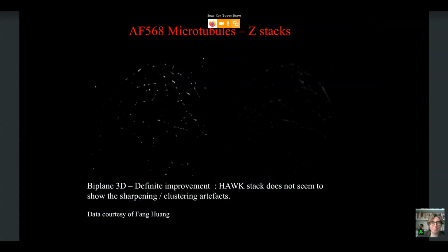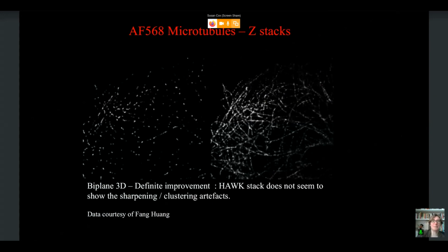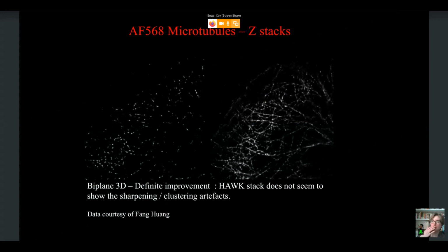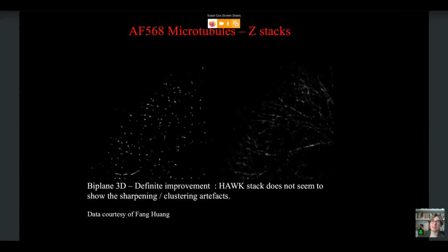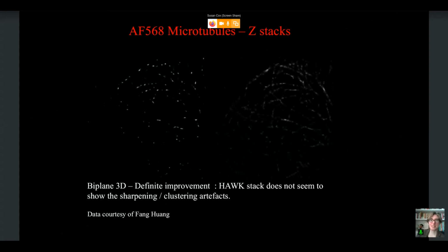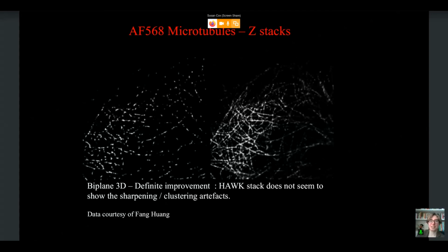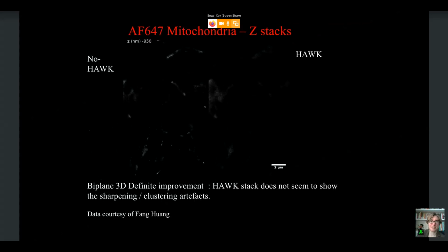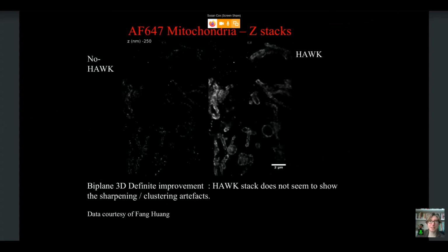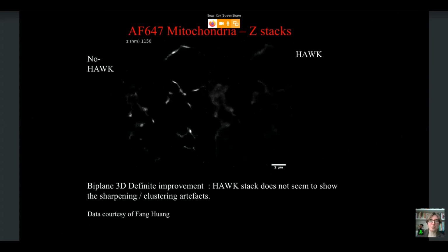Much better is the biplane approach, where we seem to actually get a really big improvement over the whole range and without any of the problematic aspects that you get with astigmatism. So this isn't published yet. We're still trying to work out the challenges with the astigmatism data, but the biplane data looked really promising. It was super simple, and it just seems to work. And here's some mitochondria. And again, we seem to just get an improvement with HAWK.